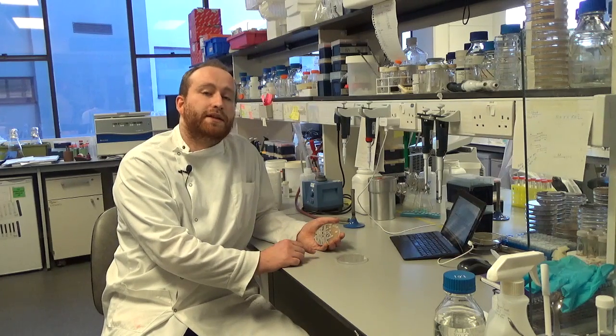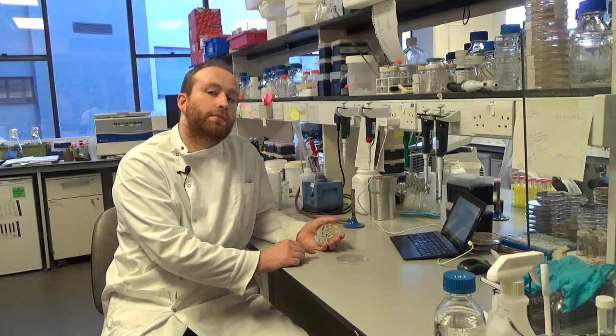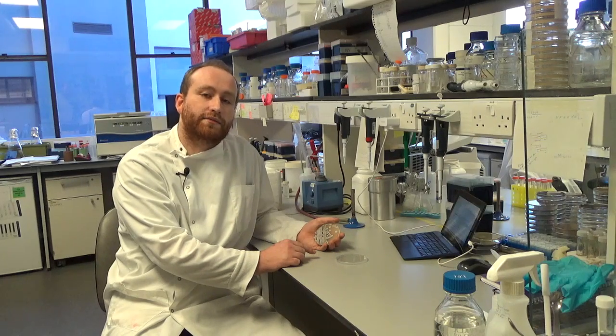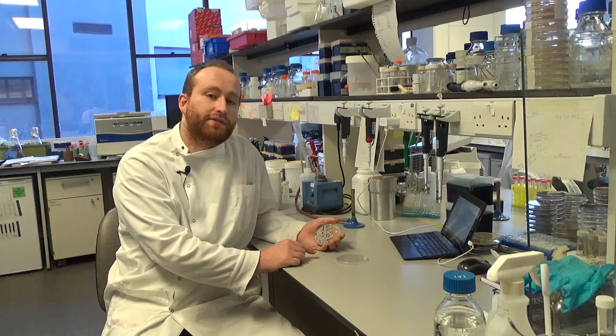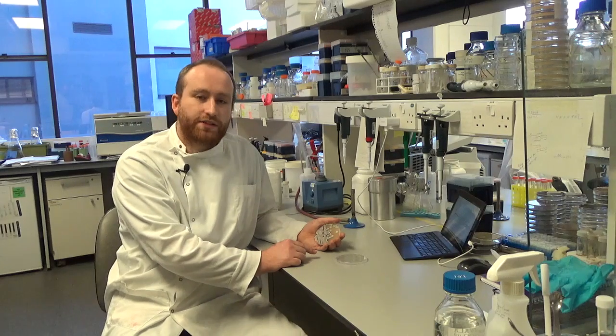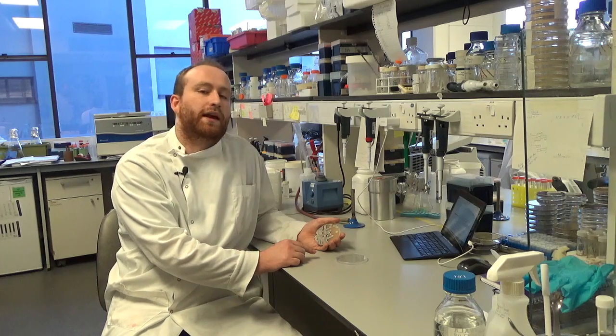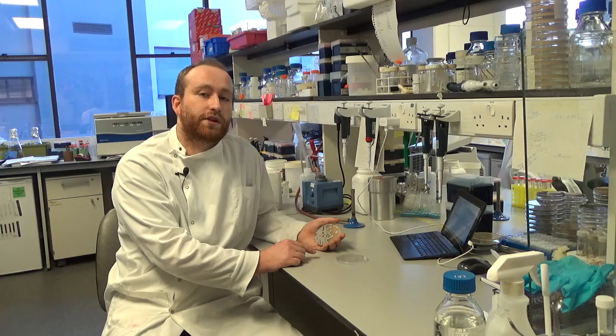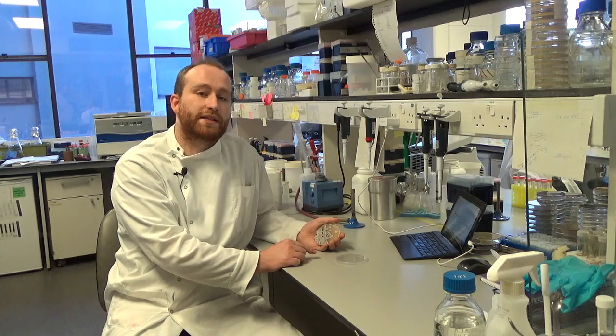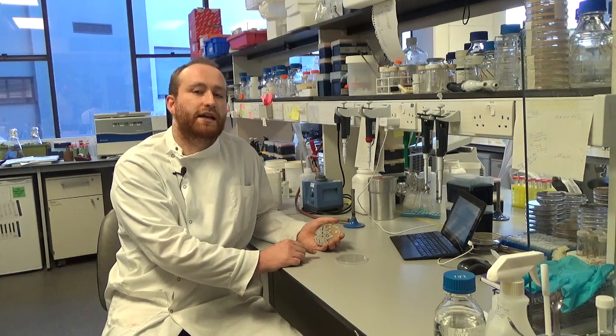Now, we're fairly certain that this bacteria is streptomyces, but we can't be sure until we've analysed the DNA. The only trouble is we don't have enough. Even if we took all the bacteria from this plate, this still wouldn't be enough. So, we're going to use a technique called PCR to make more copies of the DNA.